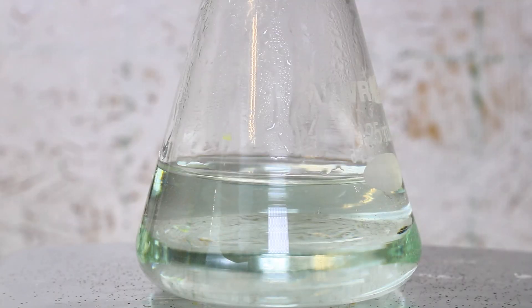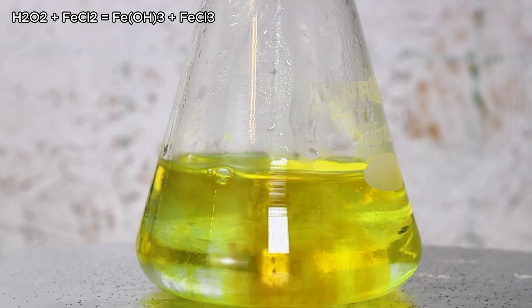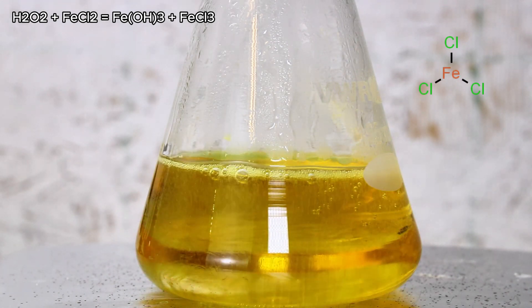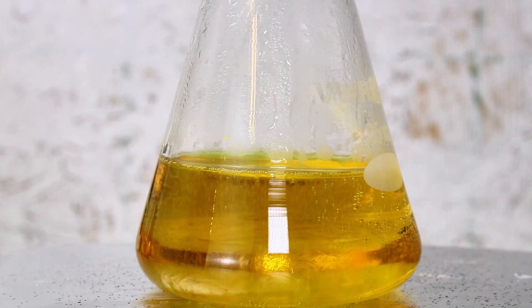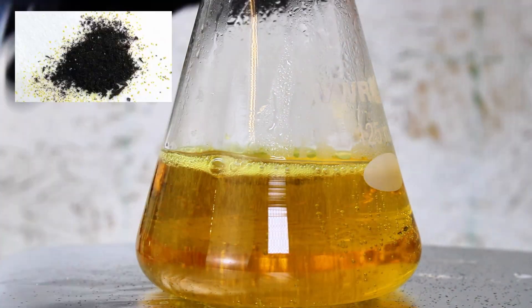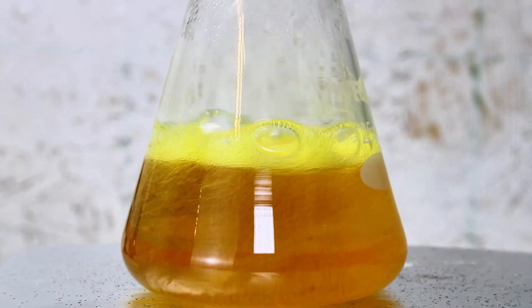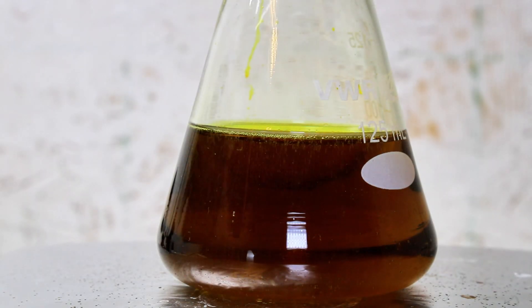Anyway, when I add some hydrogen peroxide to my dilute solution of iron(II) chloride, it becomes oxidized to iron(III) chloride. This is iron in its +3 state, and iron(III) chloride can appear yellow or orange in solution and black when dehydrated. It's a good oxidizer that's pretty hygroscopic and very difficult to crystallize.